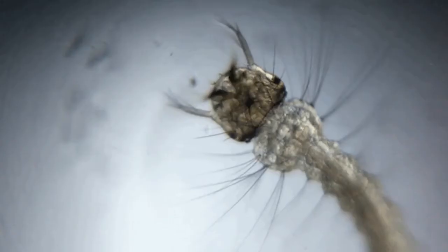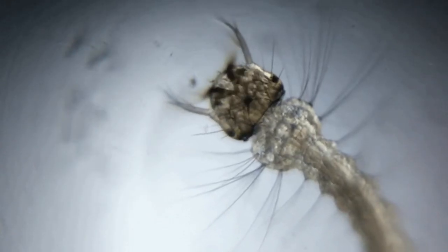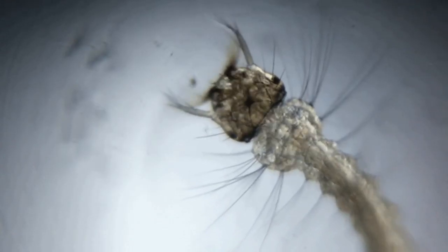We have another video on how you can place your paper slides inside the foldscope. I hope your curiosity leads you to discover fantastic things inside the microcosmos.